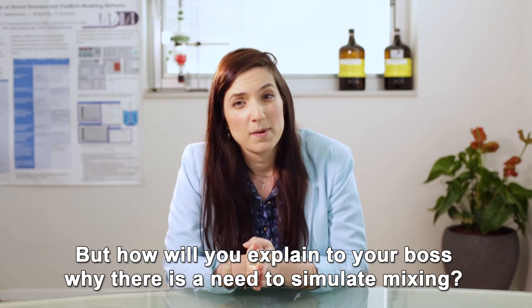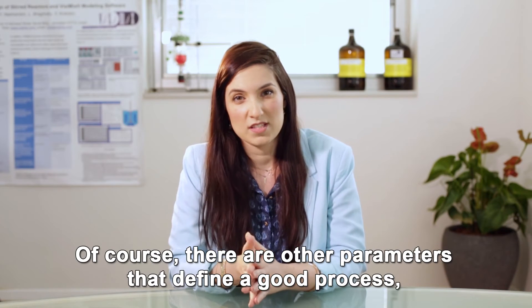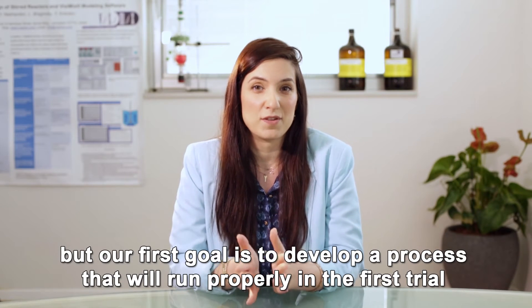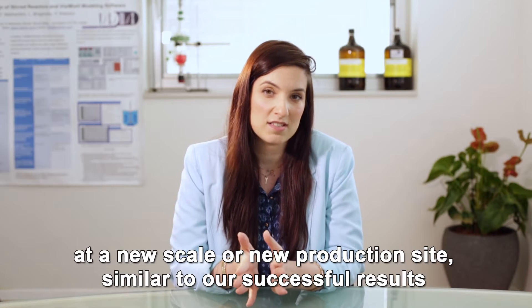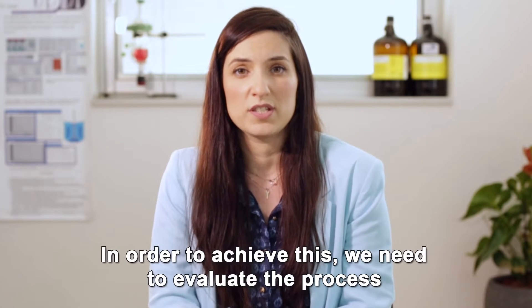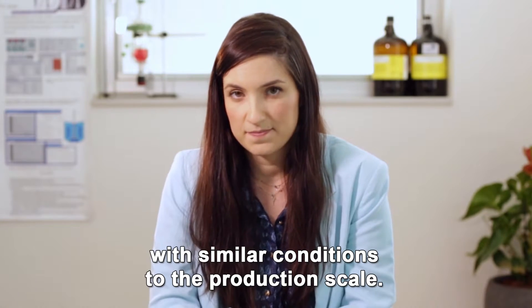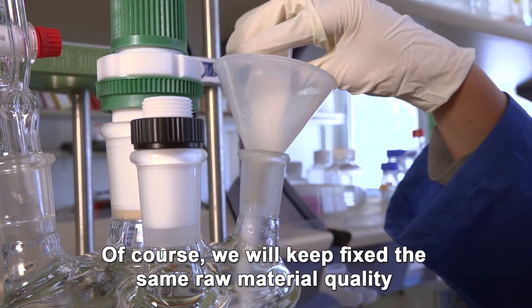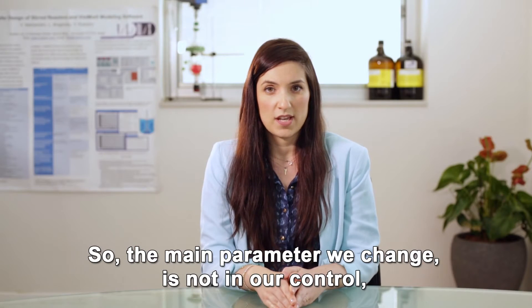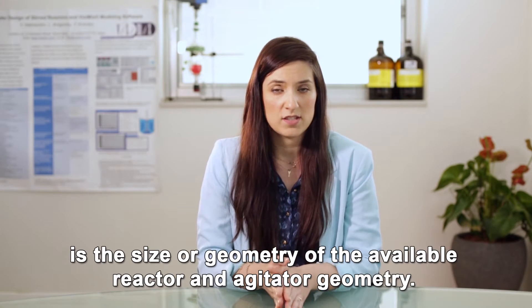But how will you explain to your boss why there is a need to simulate mixing? Of course there are other parameters that define a good process, but our first goal is to develop a process that will run properly in the first trial at the new scale or new production site, similar to our successful results in the lab or in the old facility. In order to achieve this, we need to evaluate the process with similar conditions to the production scale. Of course we will keep fixed the same raw material quality and the same procedure followed in the lab. So the main parameter we change is not in our control — it is the size or geometry of the available reactor and agitator geometry.